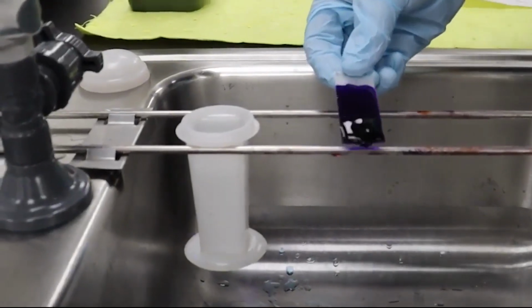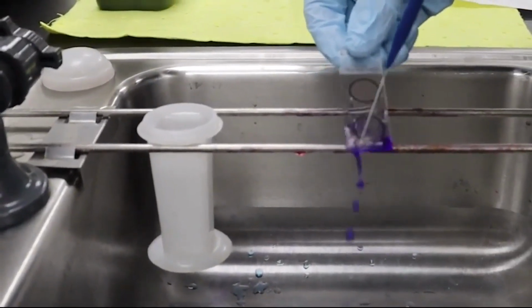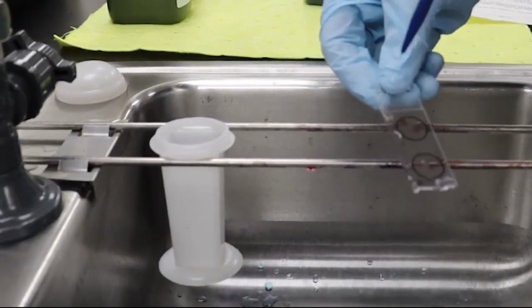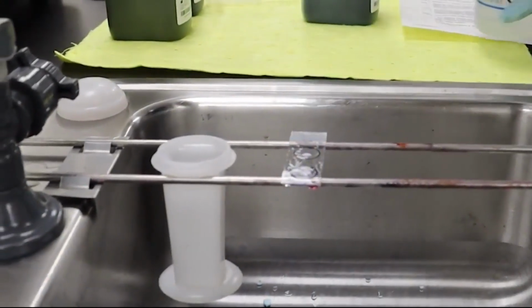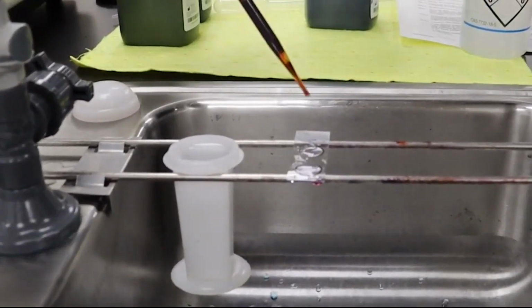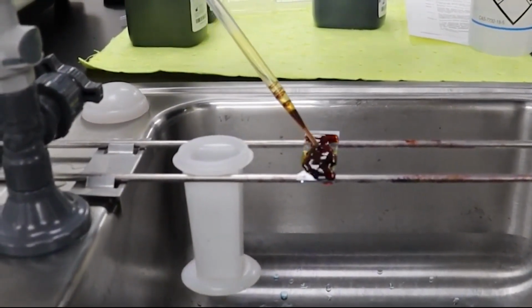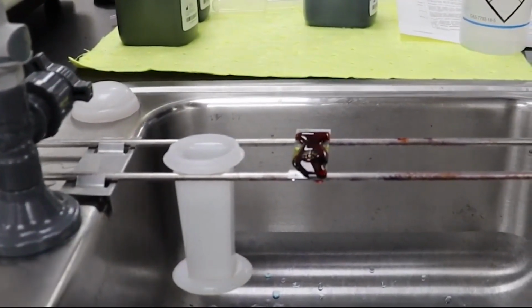We're then going to rinse the slide carefully but thoroughly with deionized water or tap water. Excessive rinsing, as shown here, may impact the final stain. Our documented procedure suggests rinsing briefly for no more than 5 seconds. We're then going to apply our iodine solution to the slide for 45 to 60 seconds, again making sure to flood the slide with enough solution to fully cover the specimen.